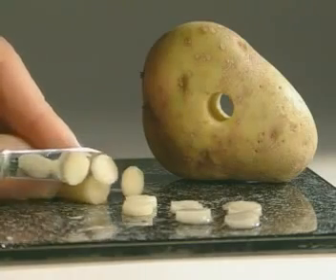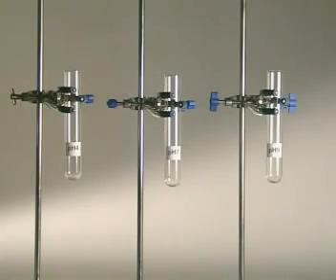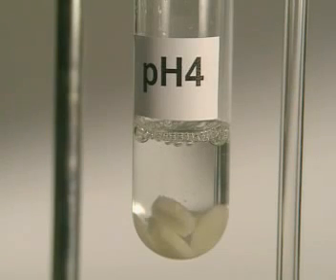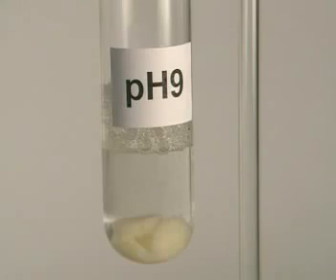As well as being dependent on temperature, enzyme activity is also dependent on pH. The same number of potato discs are placed in test tubes containing hydrogen peroxide solutions at pH 4, 7, and 9.